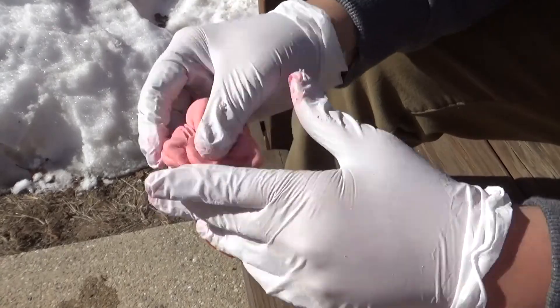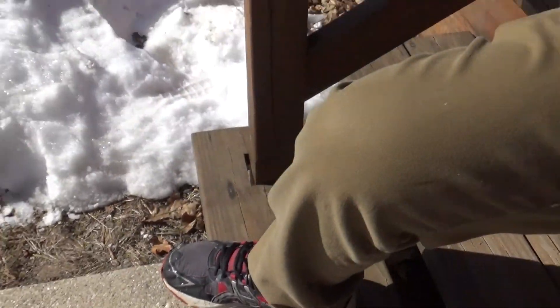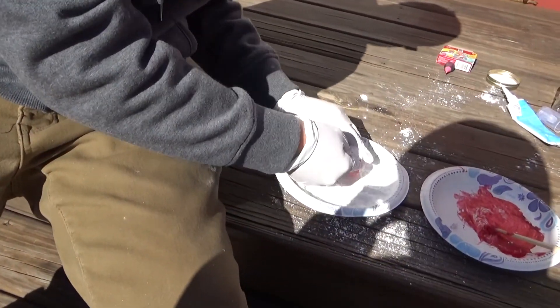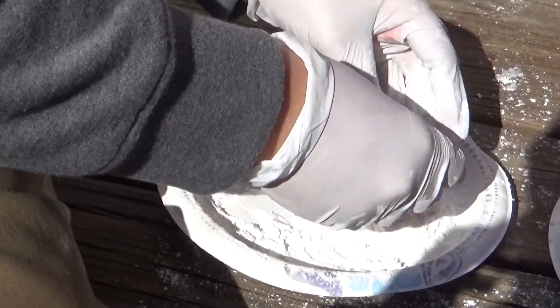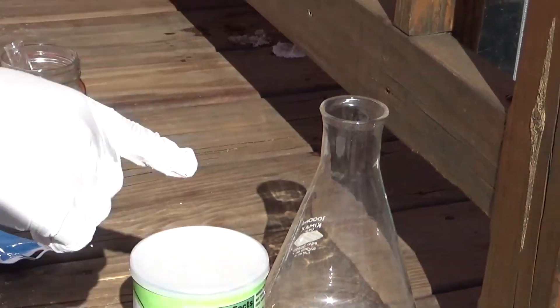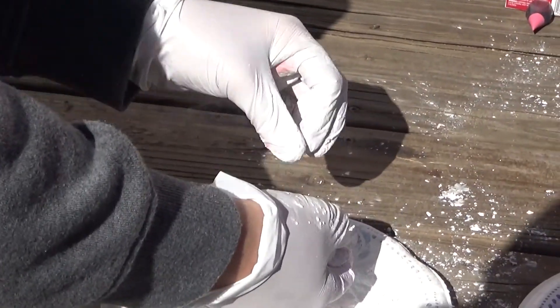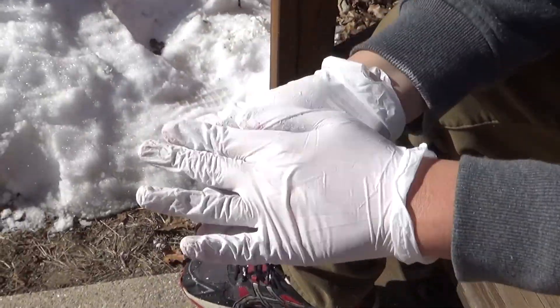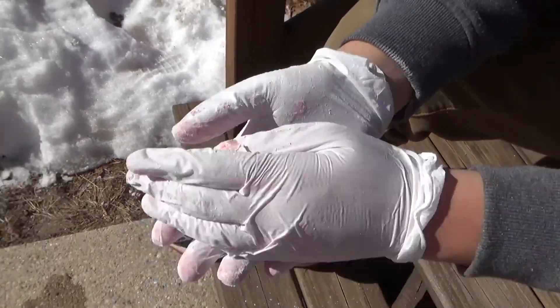Here's what the putty looks like after a few minutes of kneading. It's actually getting sticky again — all I've been doing is putting more cornstarch on it whenever it gets sticky and kneading it through. I'm going to use it to cap those two Erlenmeyer flasks over there, basically using this as a custom-made stopper. I could even poke holes in it later if I really wanted to.